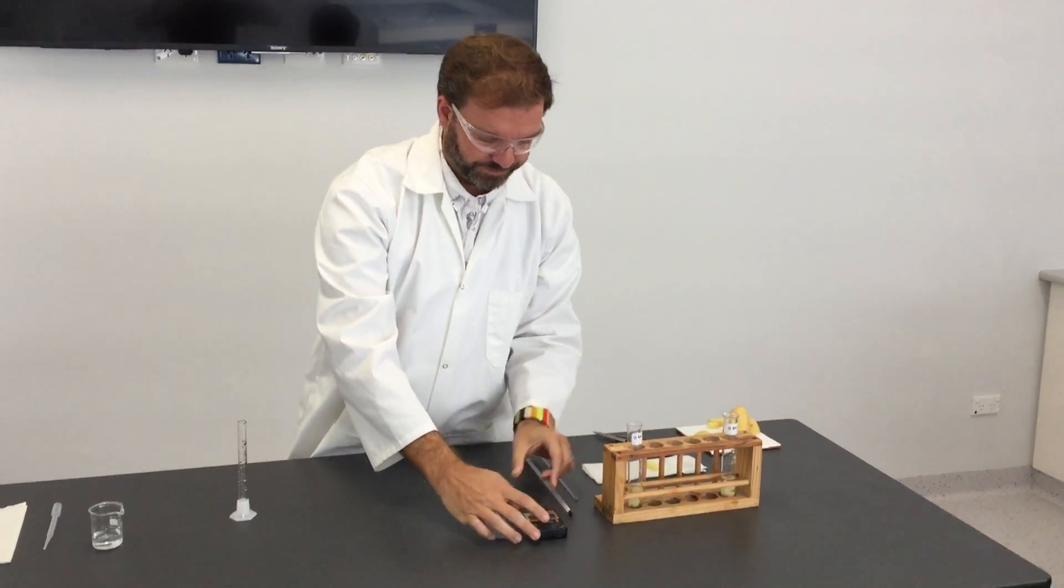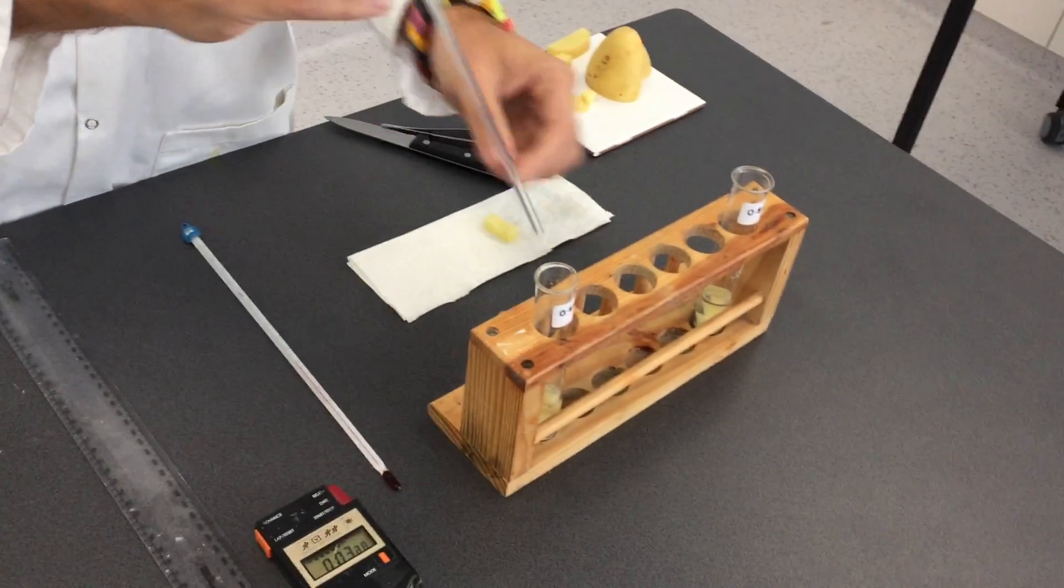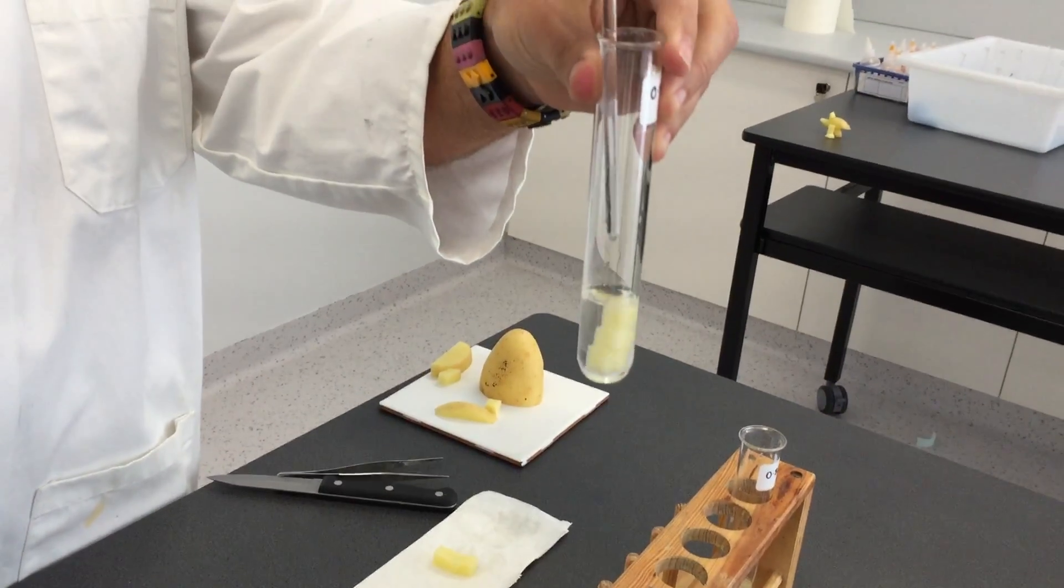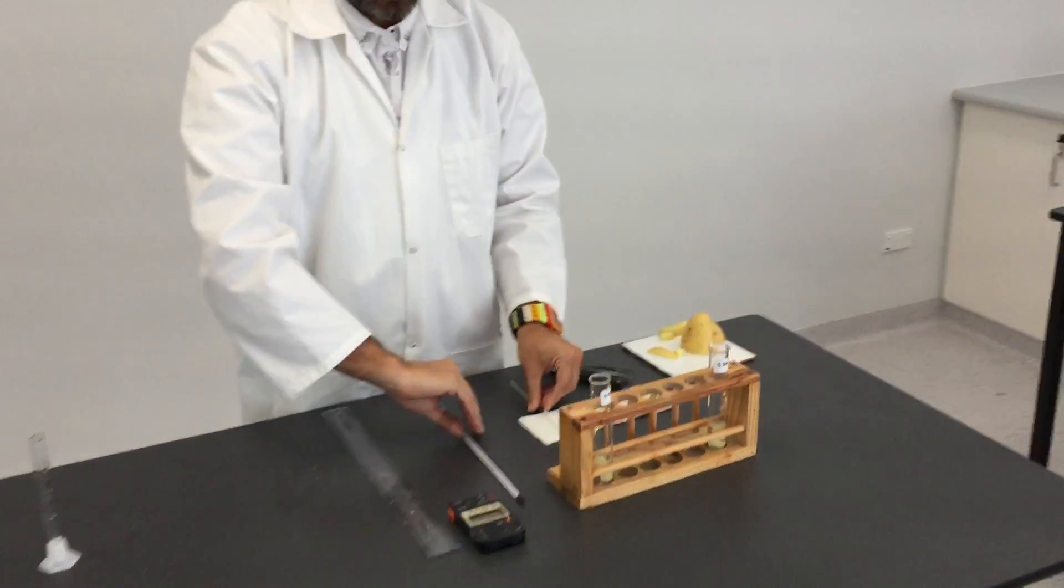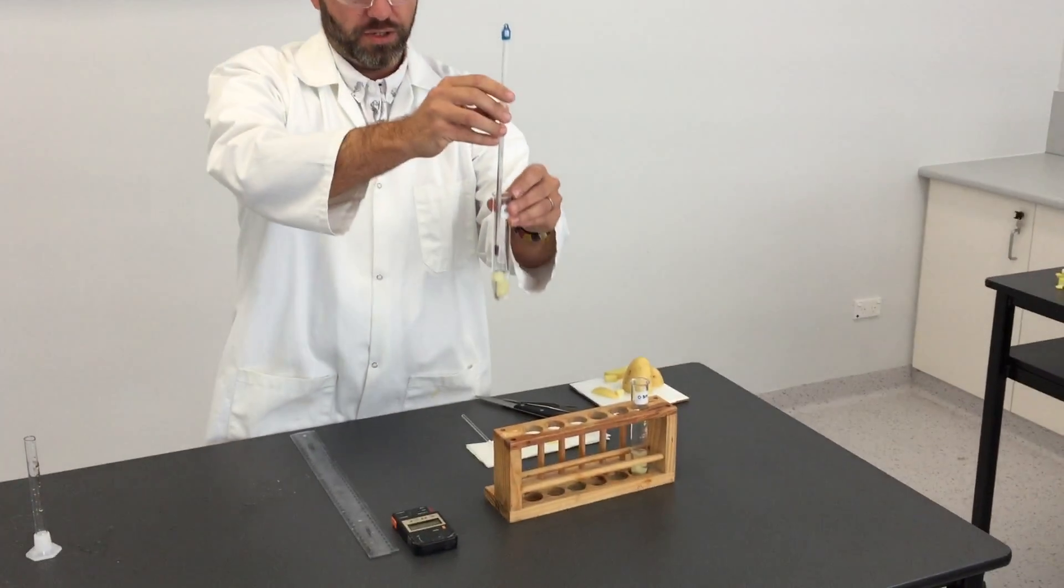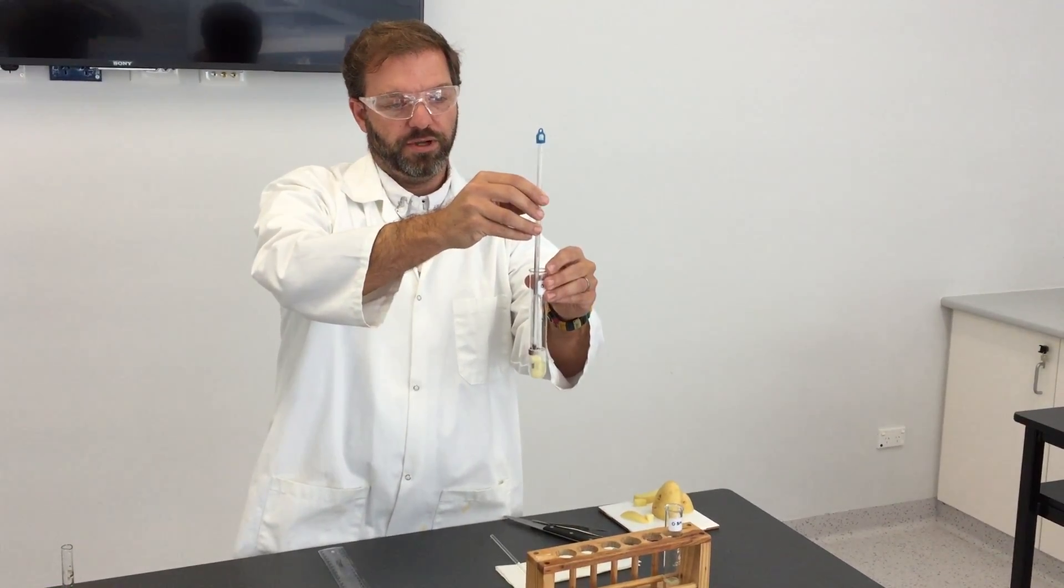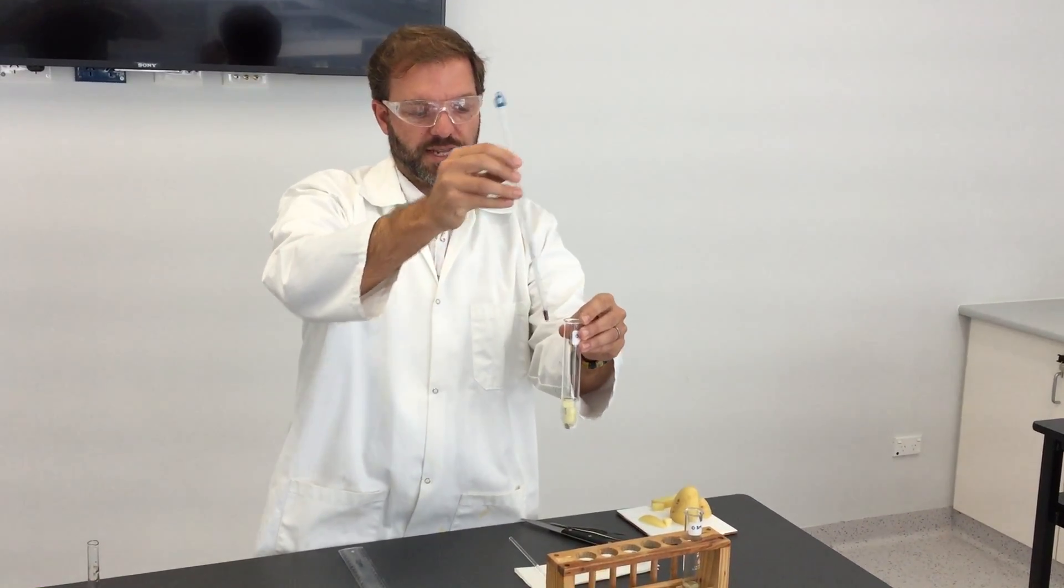And we begin the timer. At this point it might be useful just to stir that to make sure that the solution is evenly distributed. And if you're controlling the temperature, you can take the temperature of that solution before, during, and after the incubation period and check that it's staying stable.